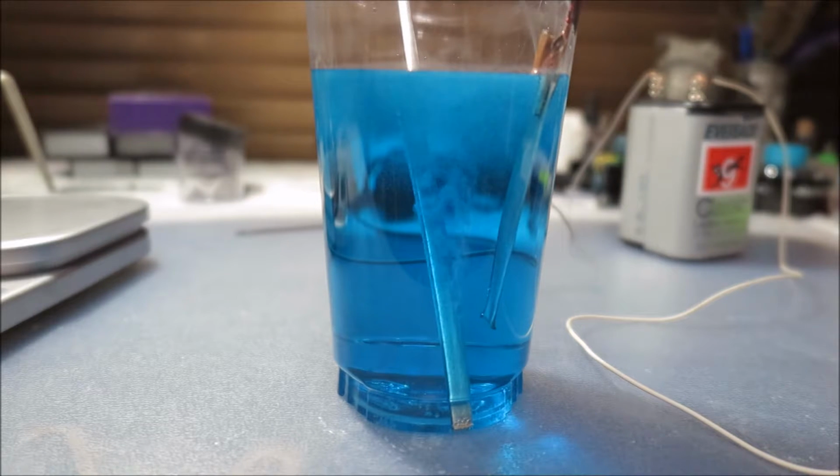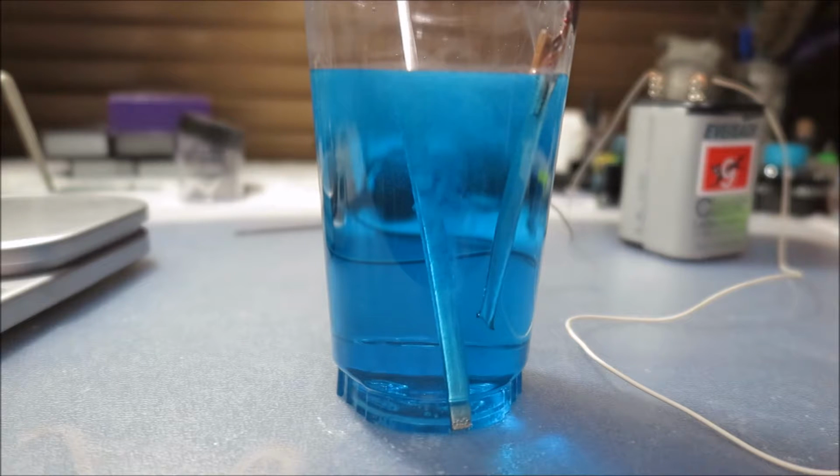The gold was unharmed, but I didn't like using gold very much. It's expensive, and if anything goes wrong, the blame's on me. So I'm using a metal chopstick instead, but this way you can see it a lot better. The beaker was a failed try, and now I think I'm on the right track. So from now on it's going to fast forward.